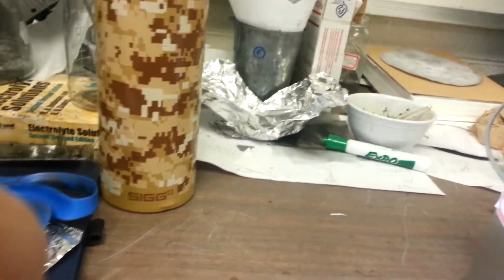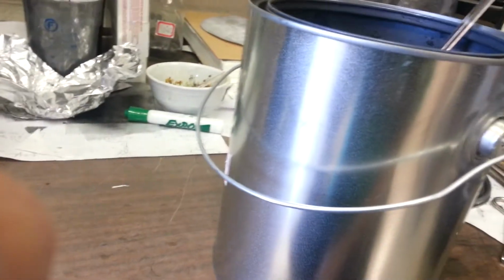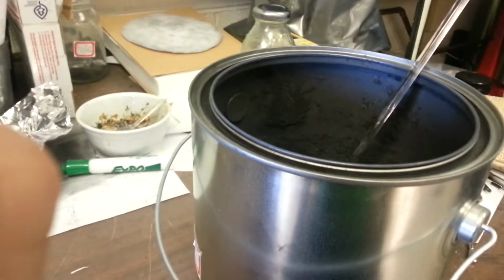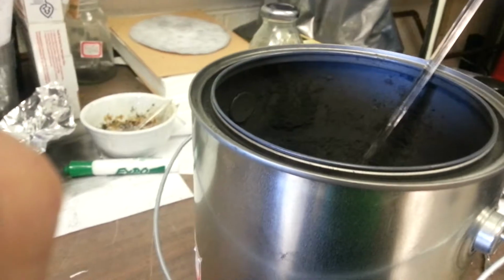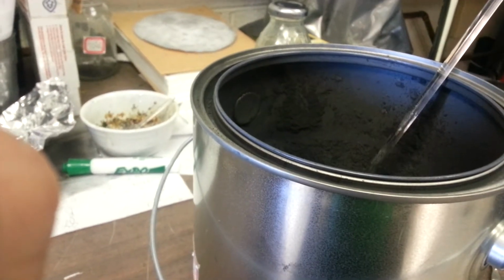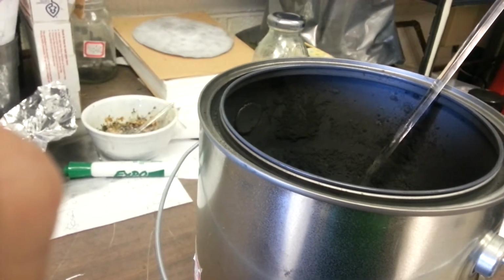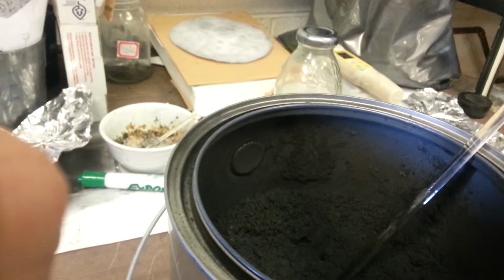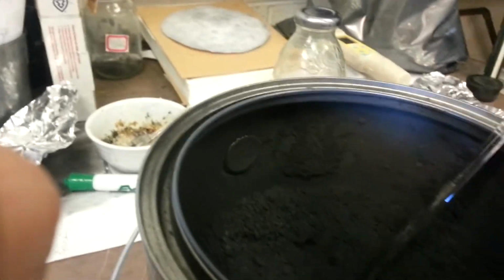cleaning wise. It's hydrophobic, so when you put water on it, it says no. It says, I will not go with you, Mr. Water. You really have to use really soapy, hot water and try to get it caught up in the soap. Because it just doesn't go with soap and water. There's all kinds of things about it that are just neat.